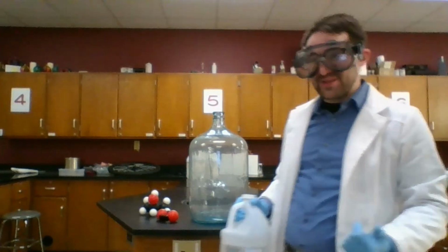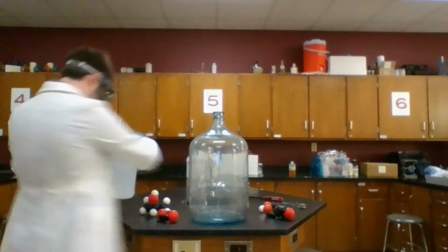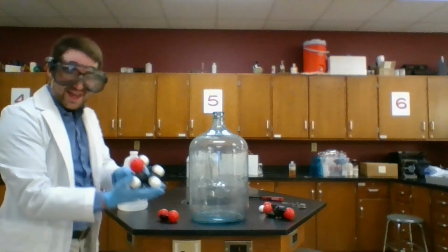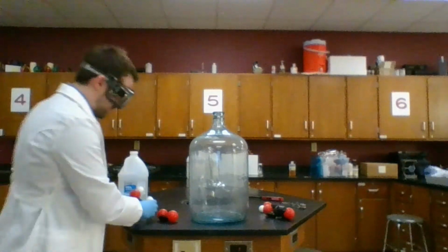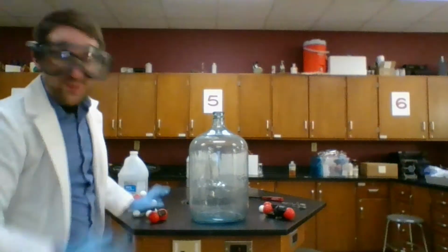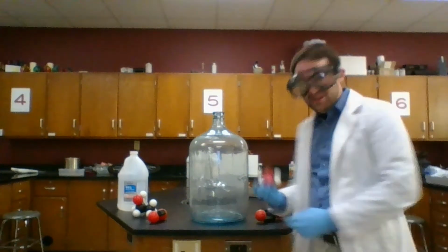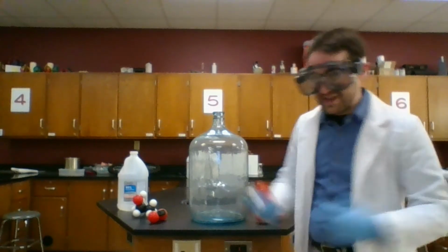Let's try it. Now again, since this is going to be a combustion reaction, the reaction equation should look very similar because it's following the same reaction type, the same pattern. The rubbing alcohol that we have here is C3H8O. We're going to react it with O2 gas that's in the air. And just like with the combustion reactions before, when this reaction happens, the products that we make are CO2 and H2O. We just balance the equation from there to make sure we're making the right amount of this and that.